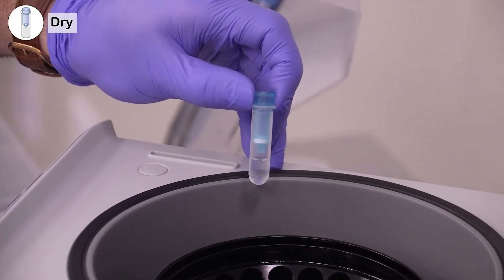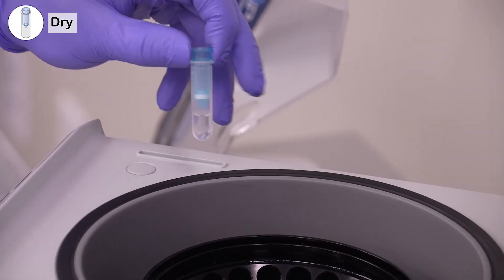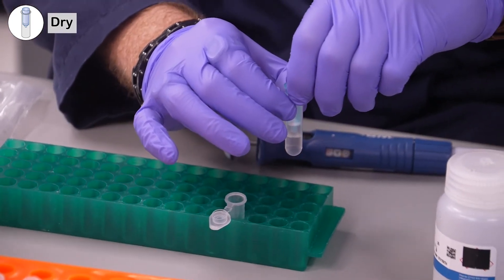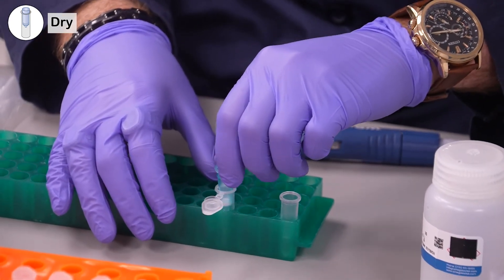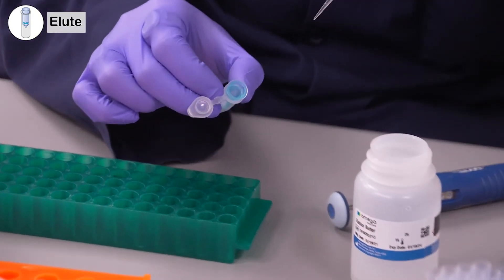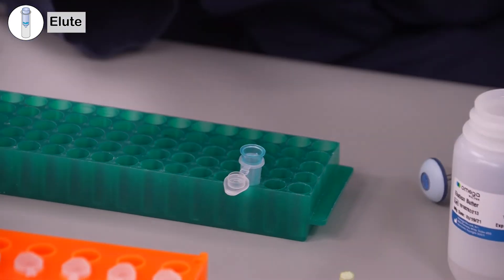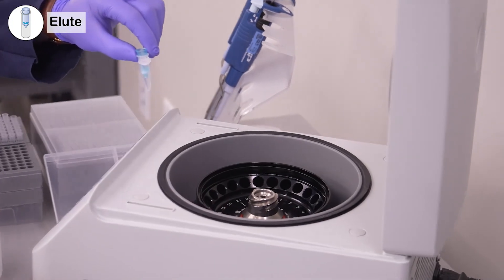At this point, you've got 600 microliters in the bottom of the collection tube, and you can see that it's almost at the tip of the high bind column — that's what we want. Grab a fresh microcentrifuge tube, take the DNA mini column out of the collection tube, and put it into the microcentrifuge tube. You can discard the collection tube. Then add 100 microliters of elution buffer directly onto the middle of the high bind column, and put this back in the centrifuge for one more minute.